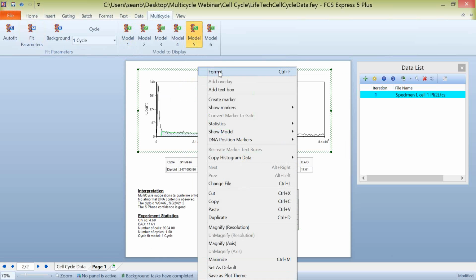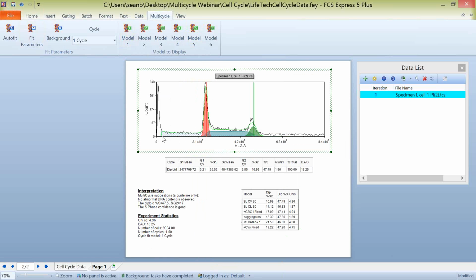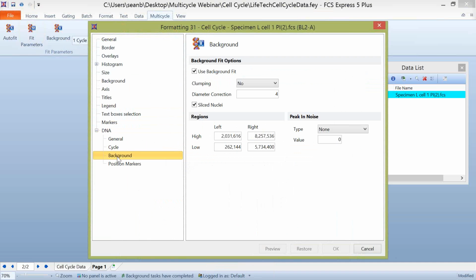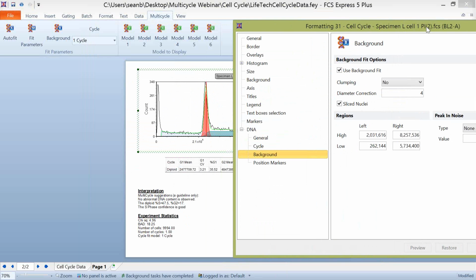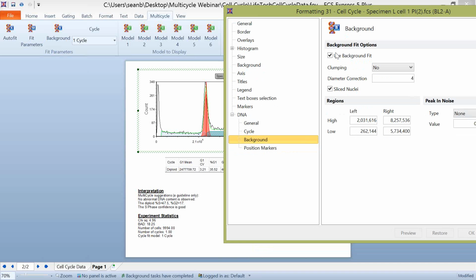Now, the other options that we have in here are essentially for the background modeling. And you can see here, again, we have the background or the noise for this data highlighted in a blue hatching. And if we right-click and choose Format, we have an entire section here for background fitting. This is all, again, provided by Multicycle with the advanced version. This isn't in the free version. But if we uncheck use background fit, you're going to notice two things. One is I want you to watch as this G1 value changes and also as this background modeling disappears. You can see our G1 went from 35% to 33%. Our background modeling is removed from there when we uncheck use background fit.